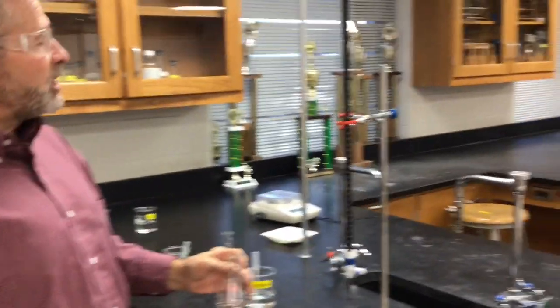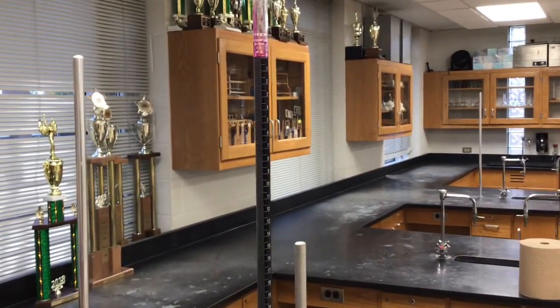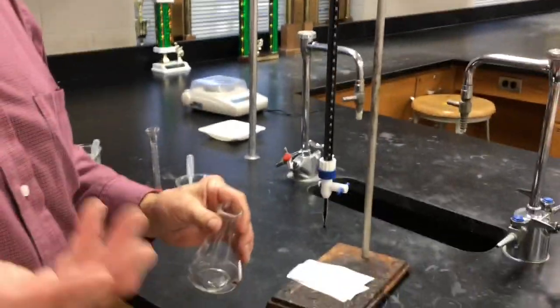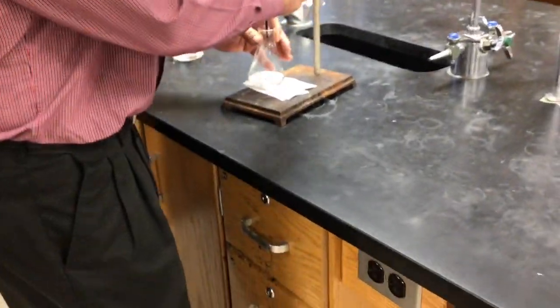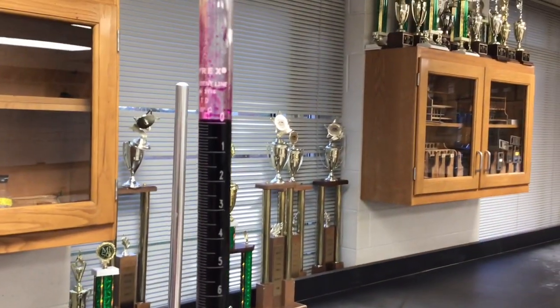We're ready to titrate. And we ran a fast and sloppy trial already. So we sort of have a ballpark idea of how much this is going to take. And so here we go. Did you show them it's at 0.00? It is 0.00, yeah. Looks like it's a little bit above the line.